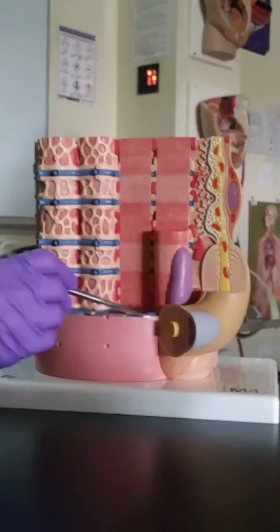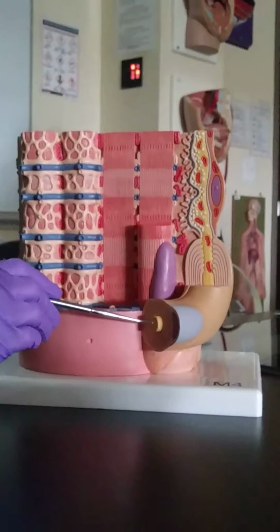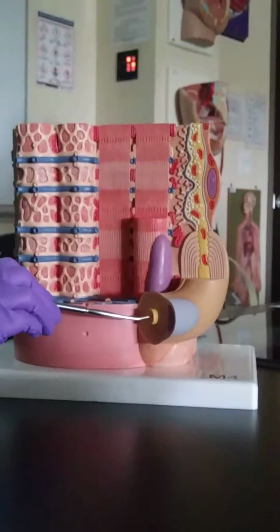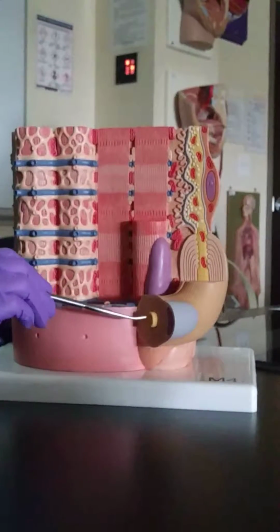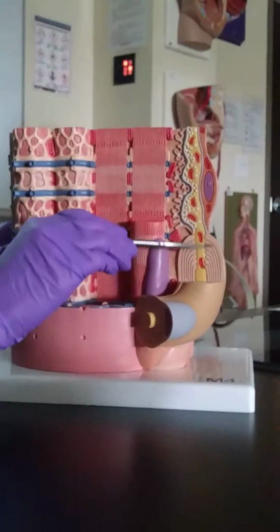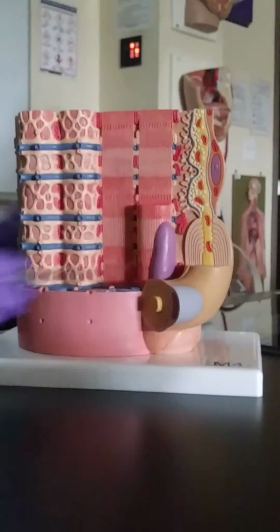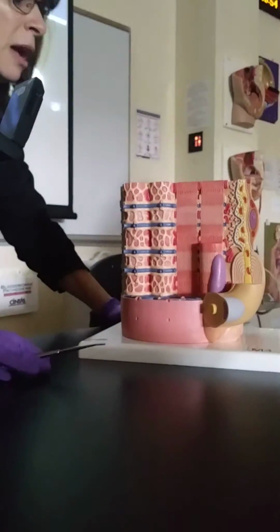Can everyone see this circle right here? That circle is, and this right here is an axon from a neuron. And this is what we're going to call the myelin sheath that surrounds the axon of the neuron. It comes and then it spreads out and forms that synaptic knob. For some of you that might be thinking, what is that? What are you talking about?